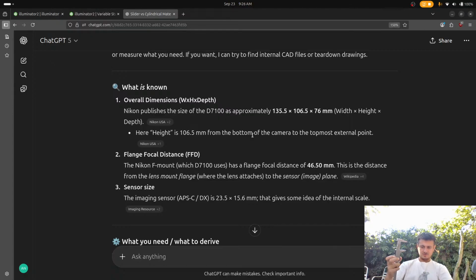But actually what we could do is if we shimmed this with maybe this paper or something. That's pretty good. And that's the thing about these cylindrical things. I guess what we could do is we could still divide this by 2. So if we do this. Okay, so that says it's 80. I'm actually more inclined to trust that measurement than if I hold this. Wait, no, but see, this is offset from the ground. So what we want to do is measure it to the paper, but the thickness of this paper isn't enough, right? It's pretty close, though.